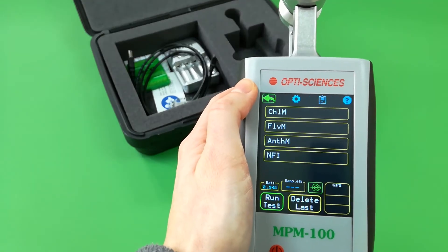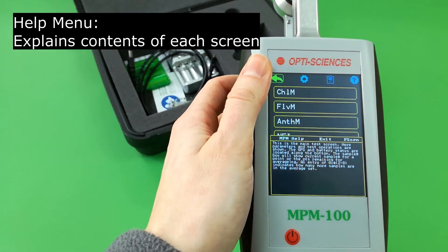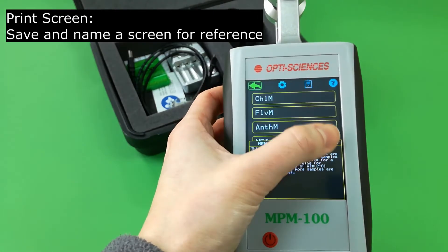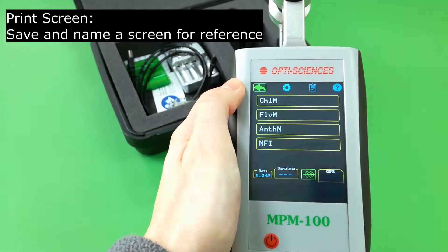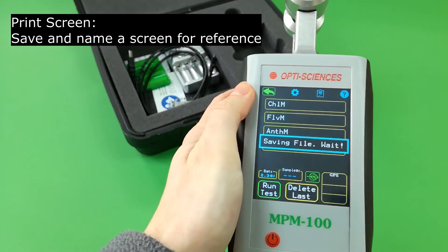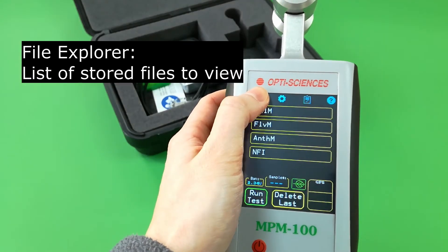From the measurement screen, the question mark icon explains the contents of each screen as you enter it on the MPM. A print screen can be taken here for reference, and is saved as a bitmap file.